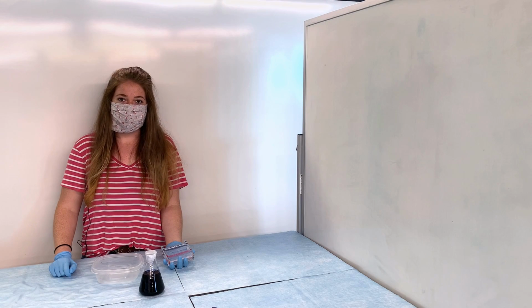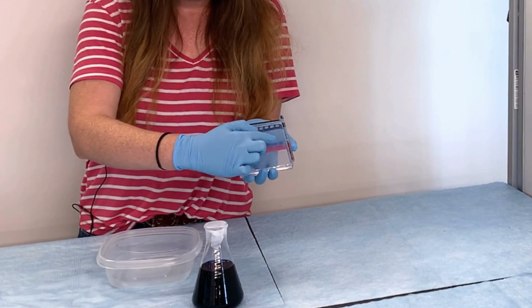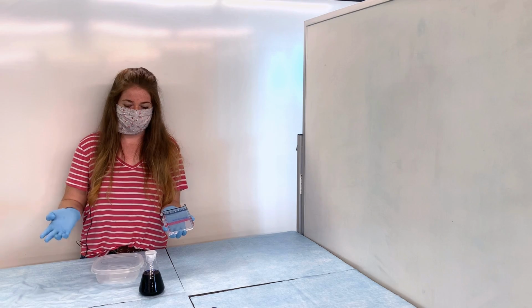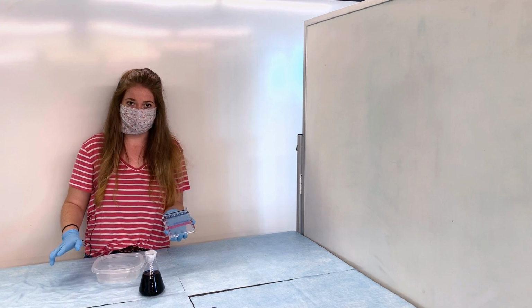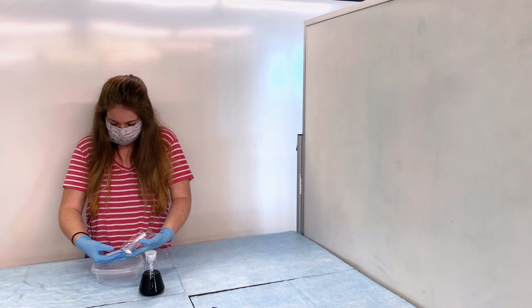Okay, so we've finished running the gel and now we need to stain it. If you can see, our staining indicator has moved about halfway, maybe a little bit more down the gel, but we can't actually see the bands right now. So I'm going to add this stain, and the whole process is going to take about 25 minutes, which I'll skip past for you guys. And then once we do that, we should be able to see the bands a little bit better.